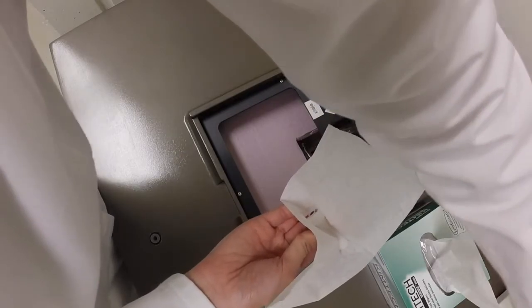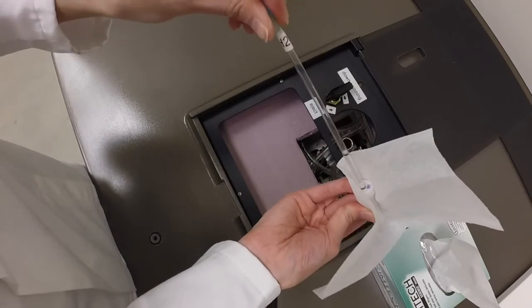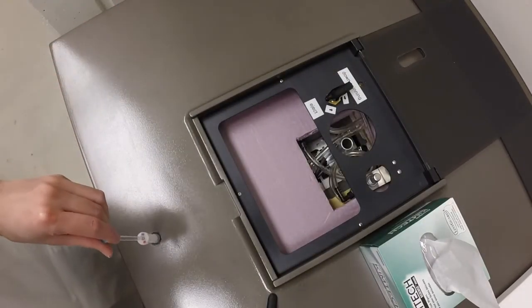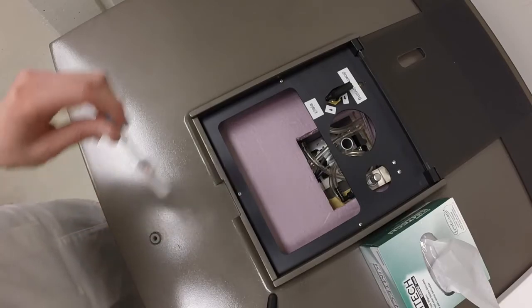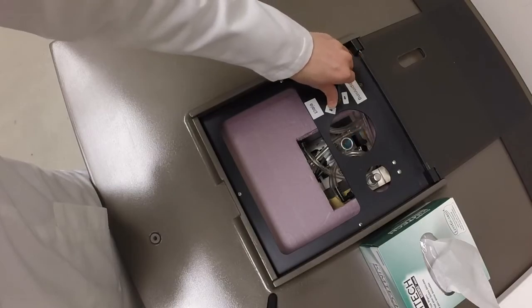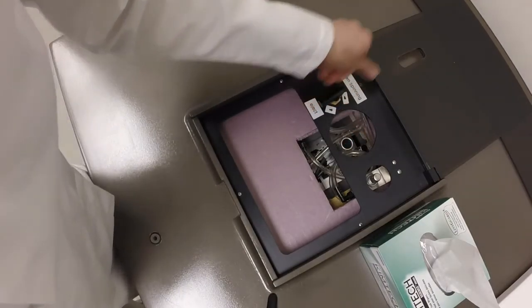If no one else is waiting to use the NMR, replace the sample with one of the standard samples. We will use the spacer to position the spinner, and then we will insert that sample into the NMR. Turn the valve counterclockwise to drop that sample. Check to make sure it's spinning, and then finally close the lid.